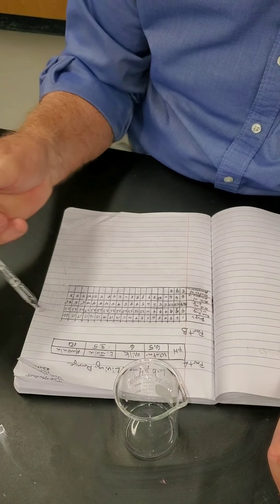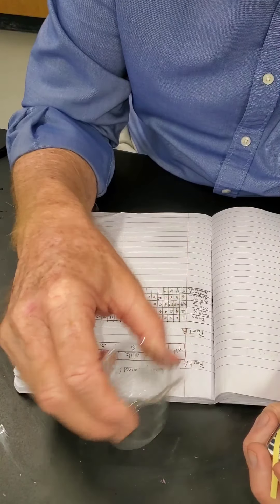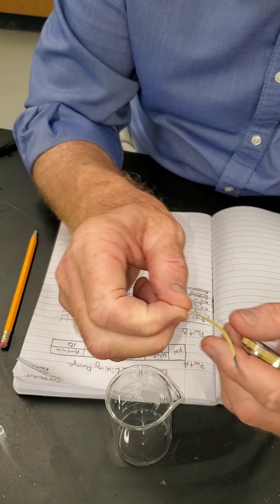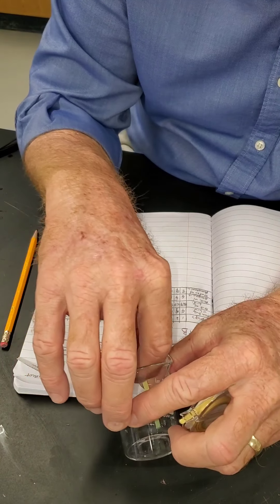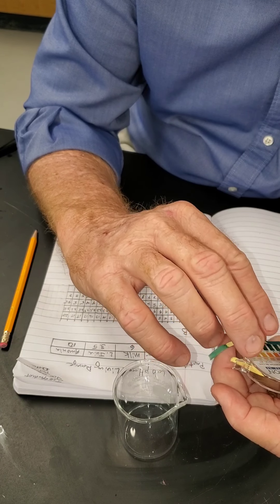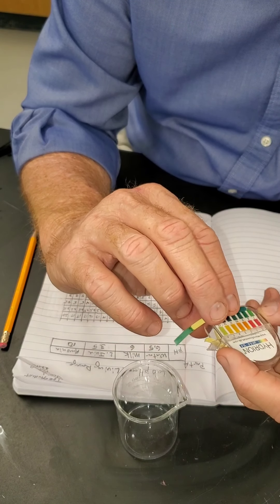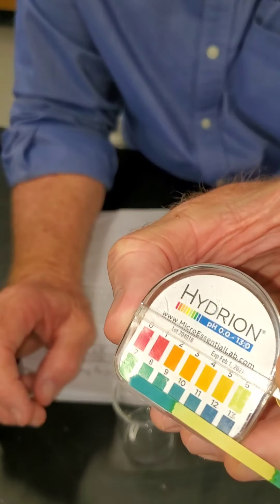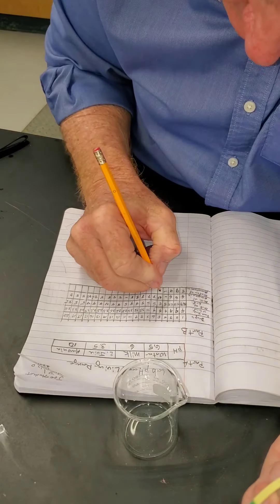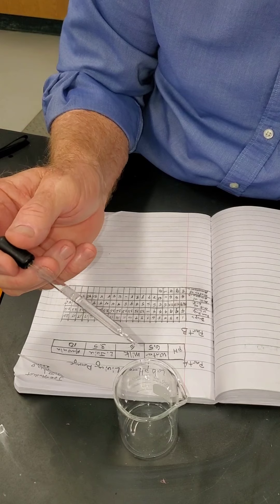Give me another drop — I gave it two drops by mistake, so drop 4 doesn't count. Try not to do that, don't get in a hurry. Take your time. This lab might take two days to finish — it's a complicated lab. After the next drops, I'm calling it 10. It's too bad about drop 4; I could have been more exact.